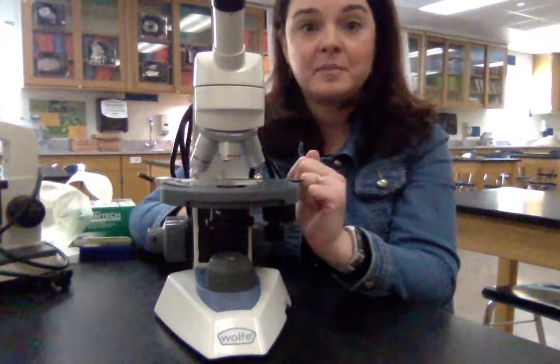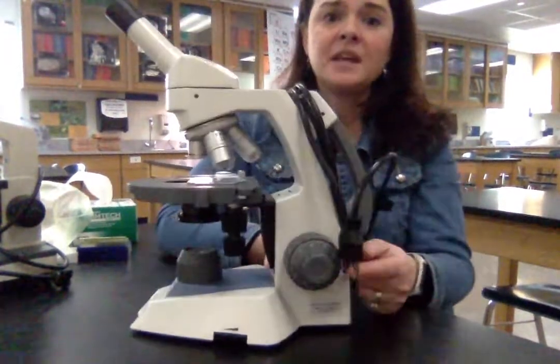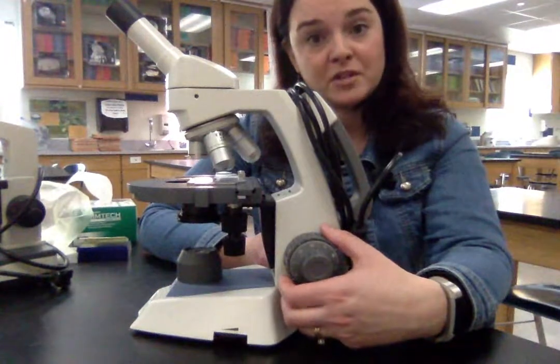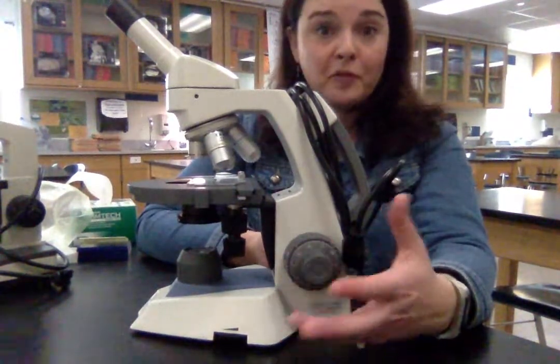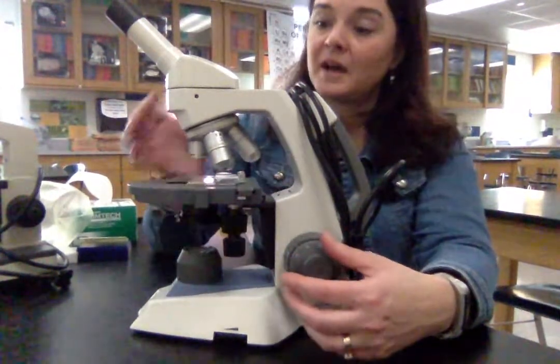We want to start on low power and look through the eyepiece to see if we can see anything. Troubleshooting: if it's black, you might need to click your nosepiece and objective into place — I've had students forget to turn their light on, so make sure it's plugged in. You're going to look through the eyepiece and use the coarse adjustment — the larger of the two knobs. The coarse adjustment moves the stage up and down. Once you've focused, you're welcome to use the fine adjustment on low power as well.